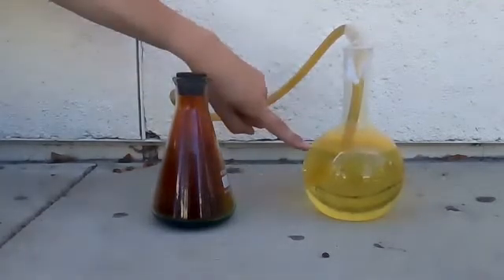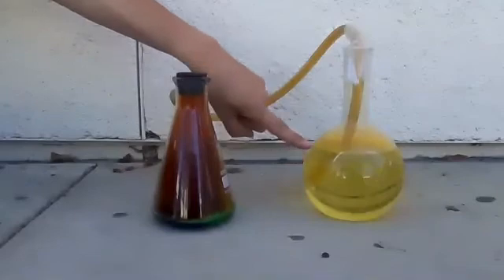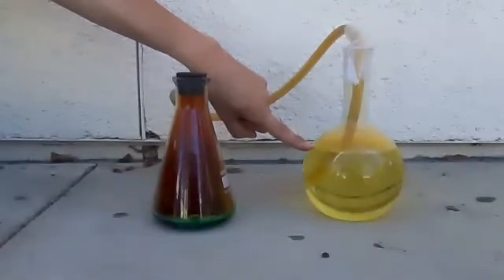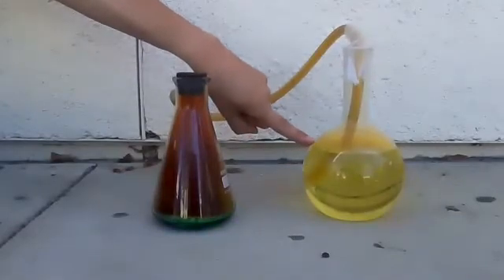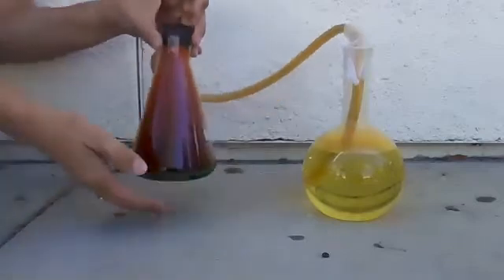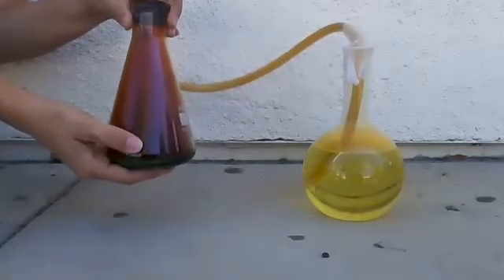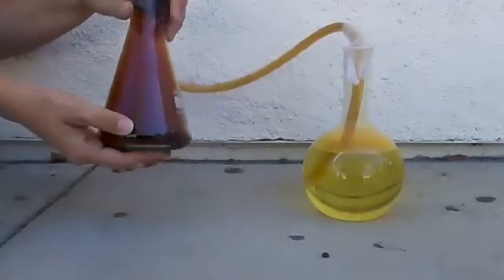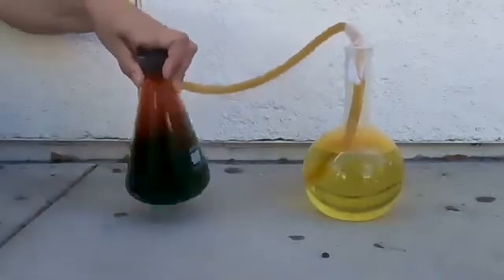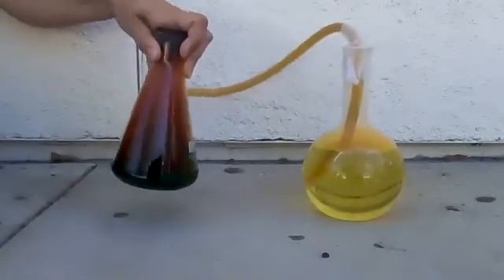So in here we're producing nitric acid — not as strong as this stuff, but we're still making nitric acid, which is turning the solution from red to yellow. If I put my hand on the bottom here, it's pretty warm — this is an exothermic reaction.